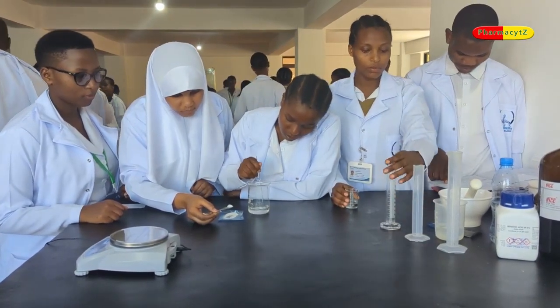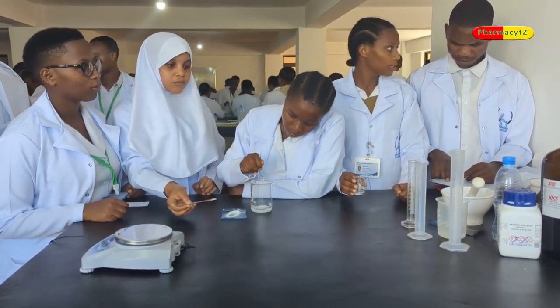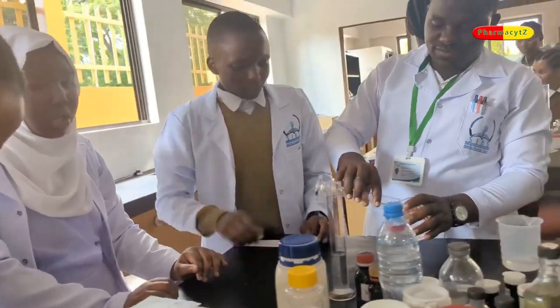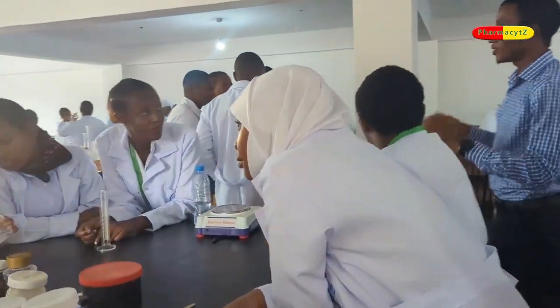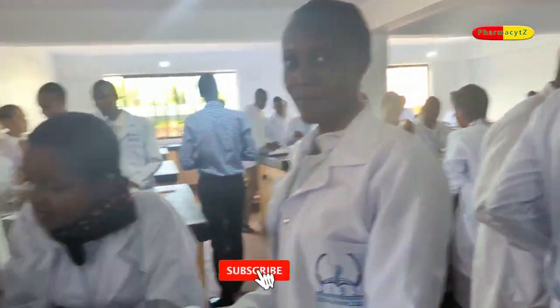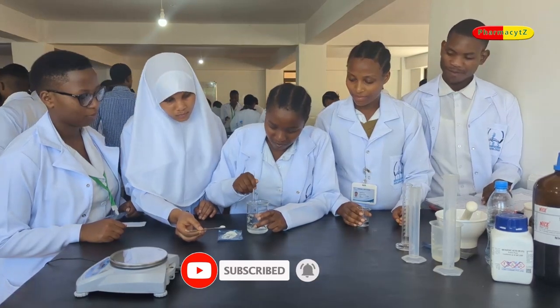The fourth step is to measure water. Measure the amount of purified water to use. Then put propylene glycol in a beaker, then dissolve benzoic acid portion-wise in this solvent. Remember, benzoic acid is added portion-wise. Do not add the next portion if the previous has not fully dissolved. You can see these students are dissolving benzoic acid portion-wise. Put portion after portion, portion after portion.